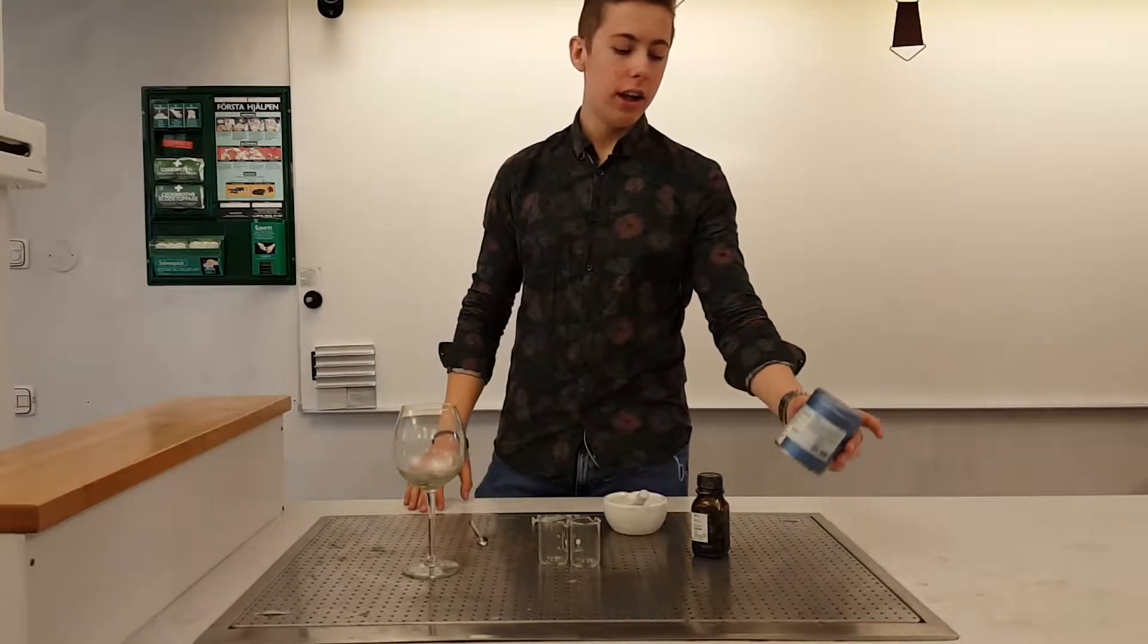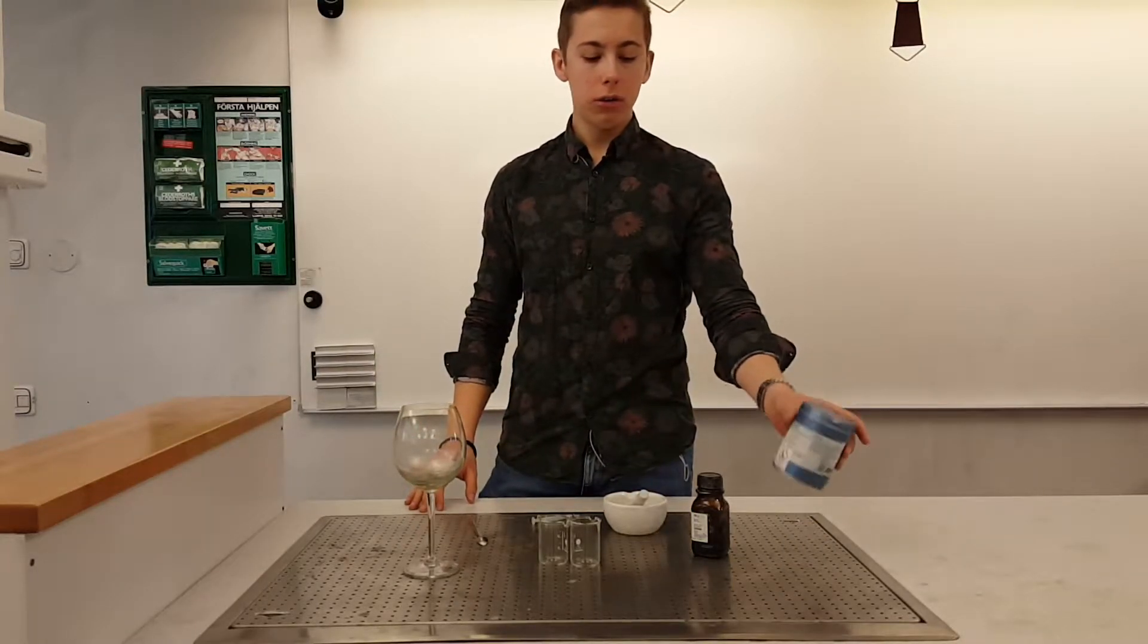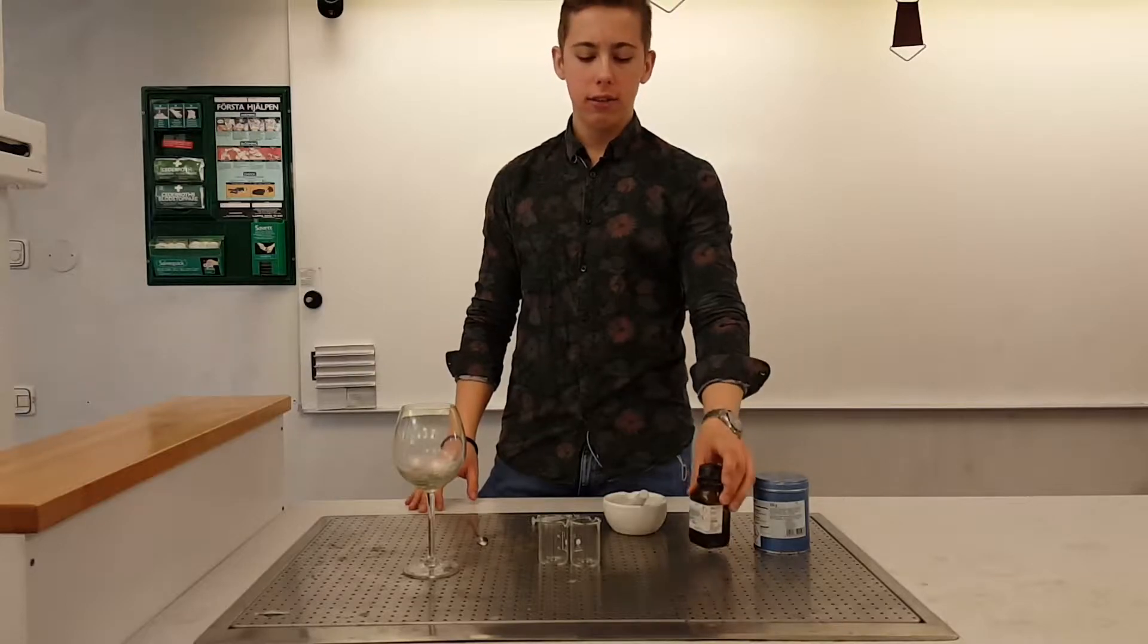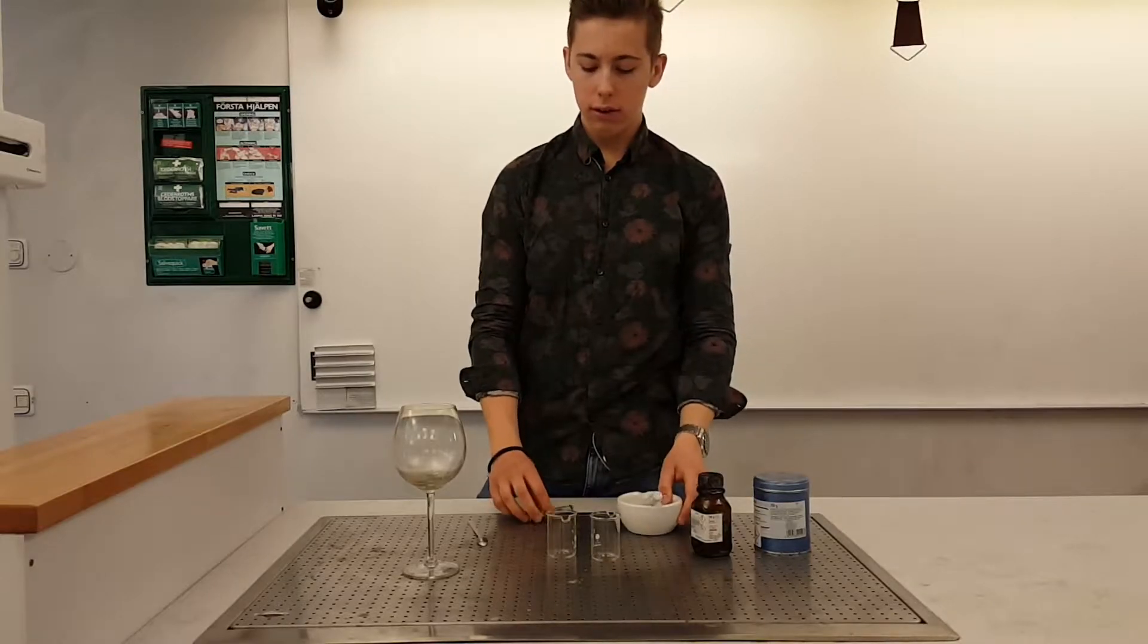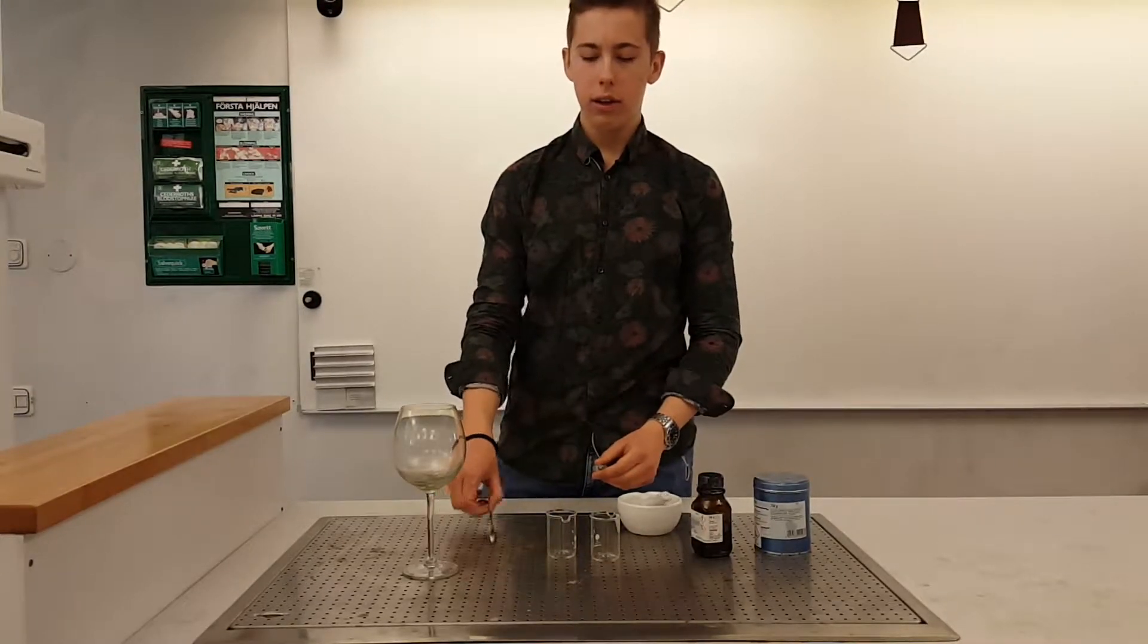For the experiment we're going to need aluminum powder, iodine, two cups, a mortar, a pipette and a spoon.